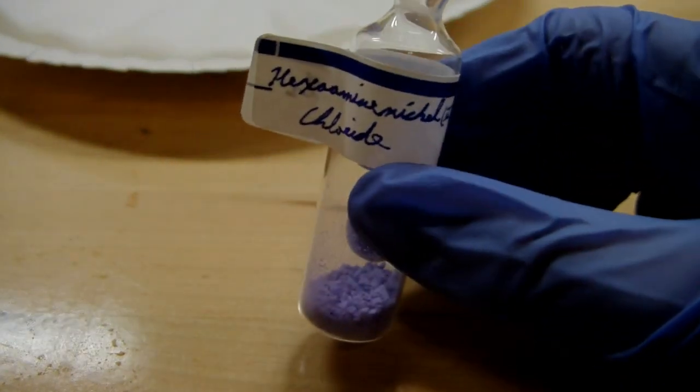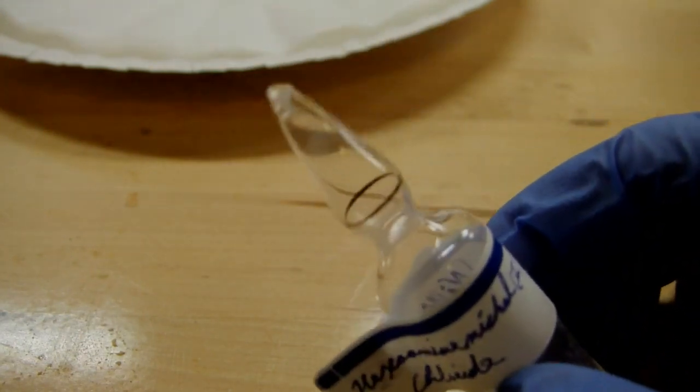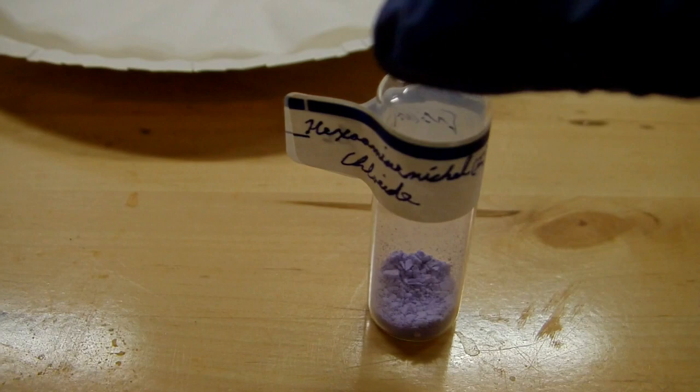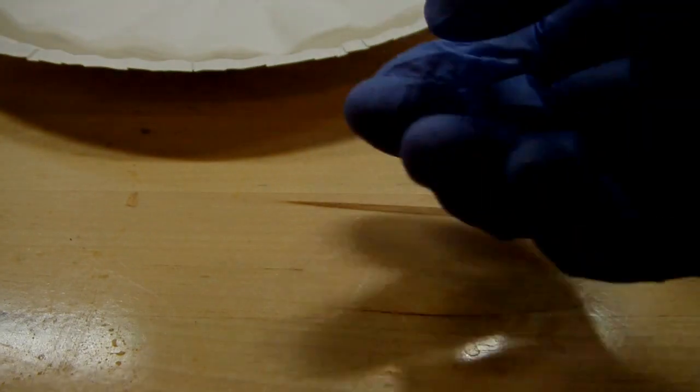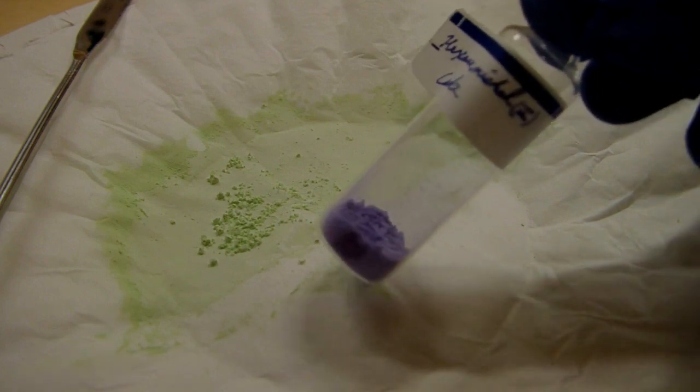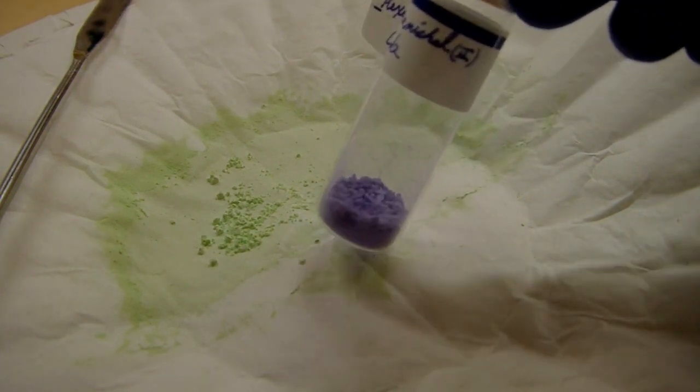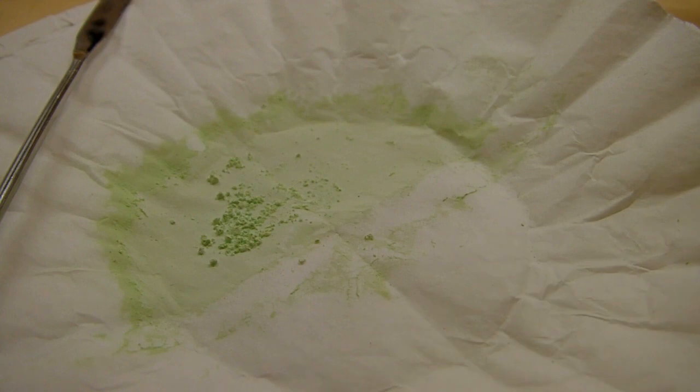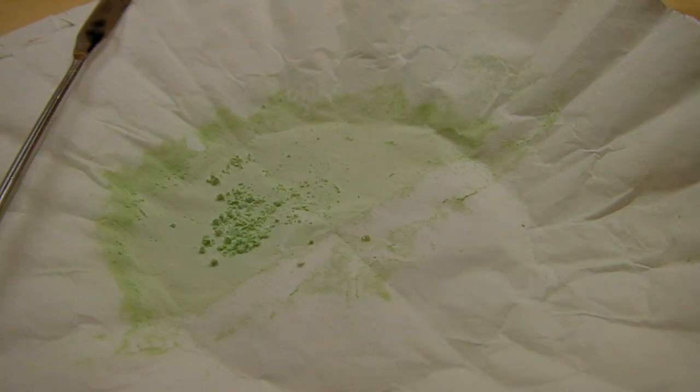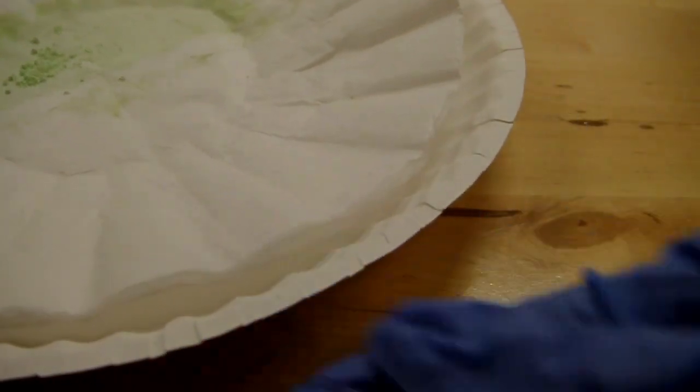You can see it's just this really beautiful lavender color and I've sealed it in a glass ampule for storage because what I noticed was I left some out to dry and it looks like it's at least mildly air sensitive. You can see that the residue on the filter paper here is completely discolored. It's all green now so compare that to the purple that it was. So I guess on exposure to air or maybe even something just in my lab here it reacted with it and discolored it. So I'm going to store it in this ampule just to make sure that it's protected from the air.